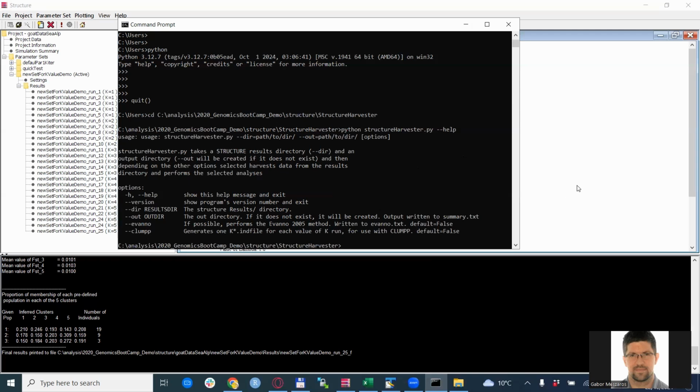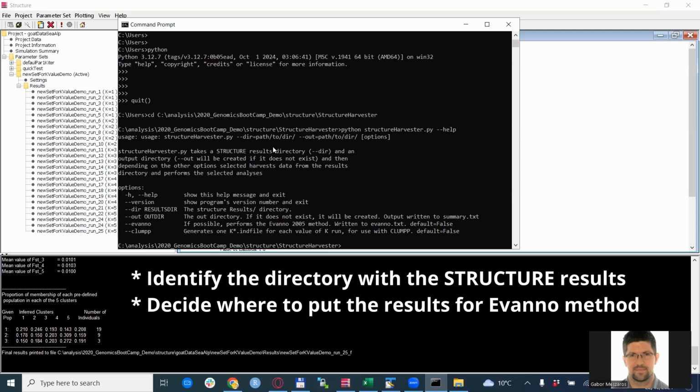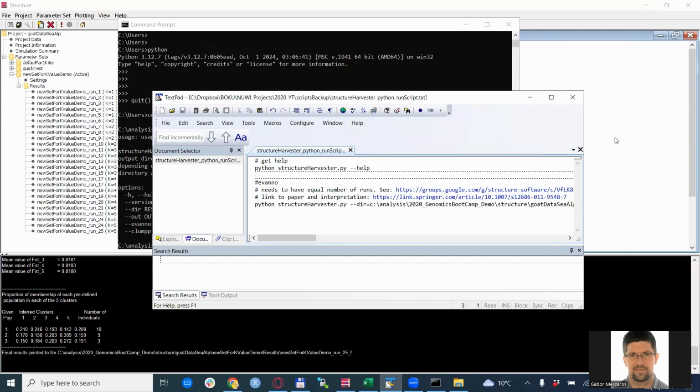If you see something like this, with the options and other things displayed, you are on a very good way. What you need to do is identify the directory with your results and then decide where you want to put the results. You can type directly into the command prompt, but I always suggest putting the scripts in a text file first. That way, if you make a typo or you want to reuse the same line in the future, you will have a much easier time. So this is what I did also.